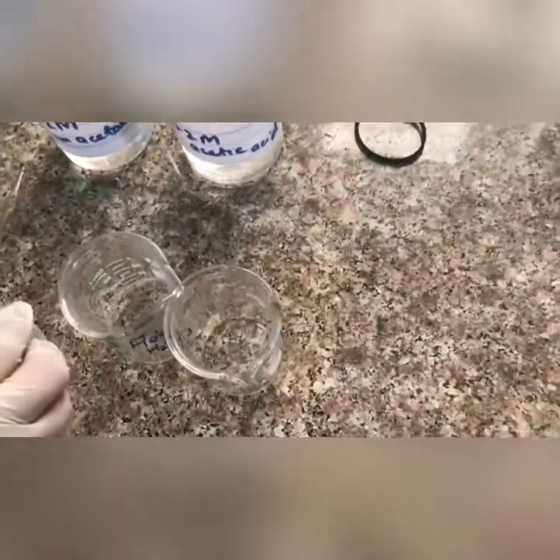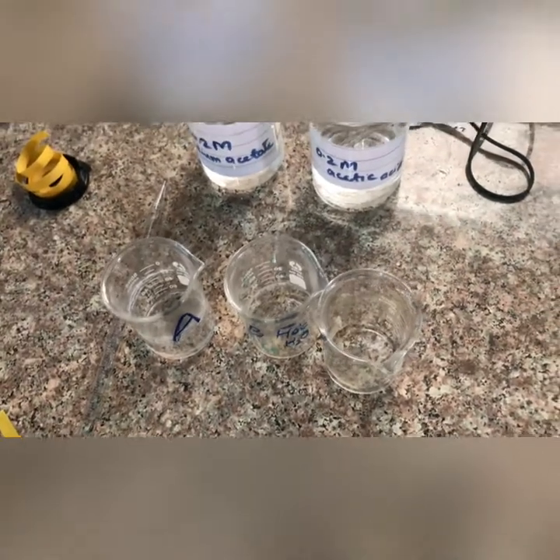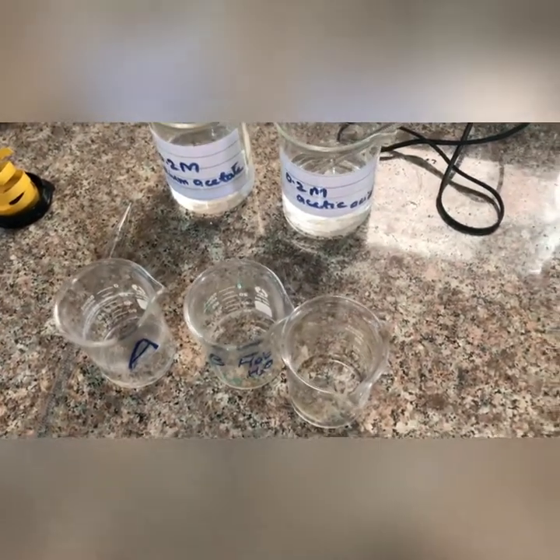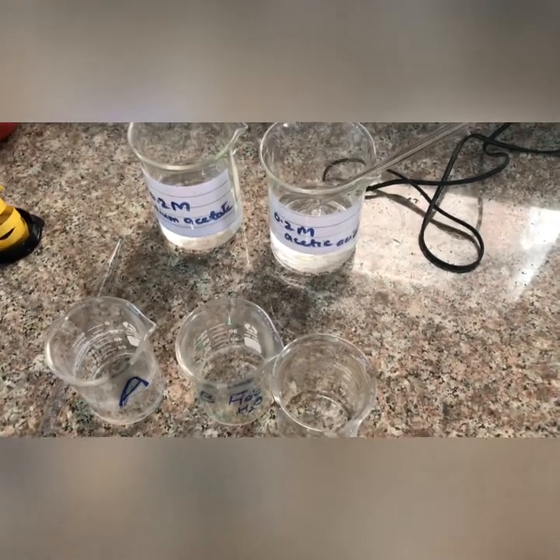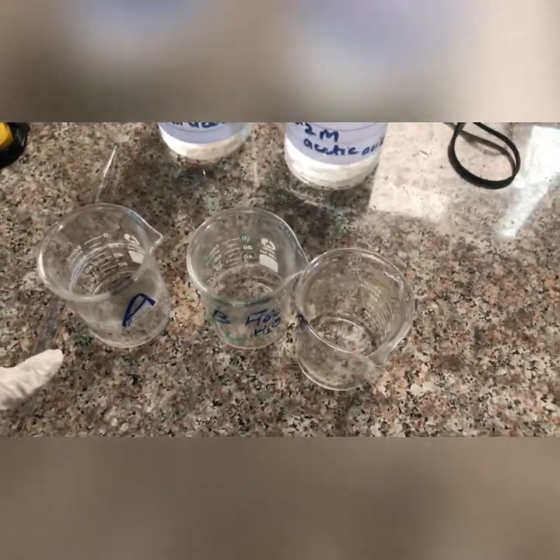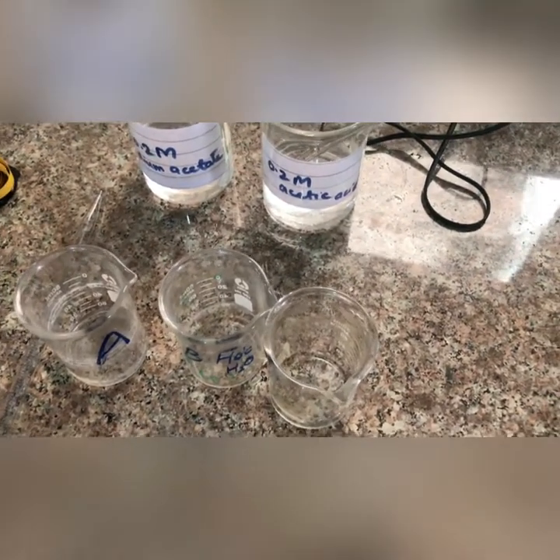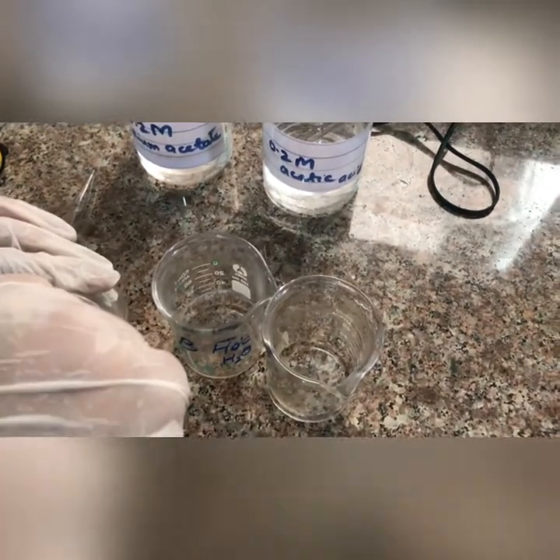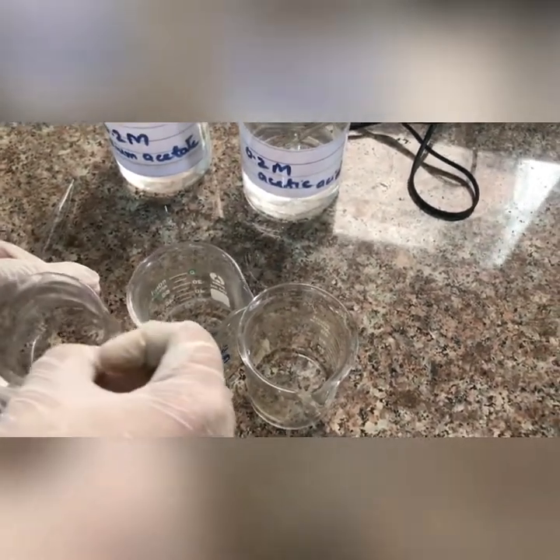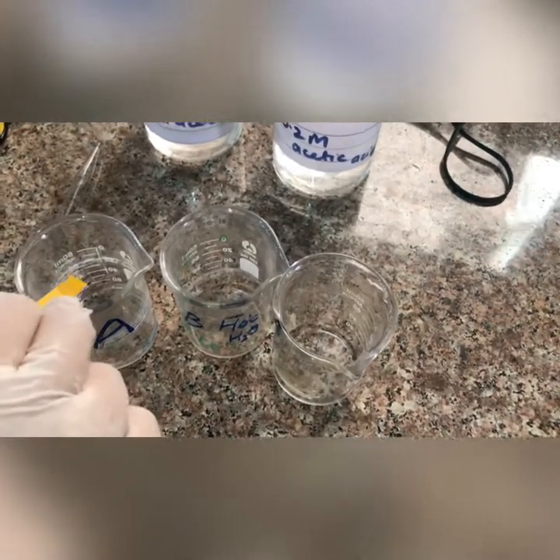We will mix it and find the pH. Basically, we have a reference range which we call the pKa value. The pKa value of acetic acid is 4.7. We need to compare it — when acetic acid is in greater quantity and sodium acetate is in lesser quantity, like in beaker A, the pH should be less than 4.7. We will use pH paper to measure this.